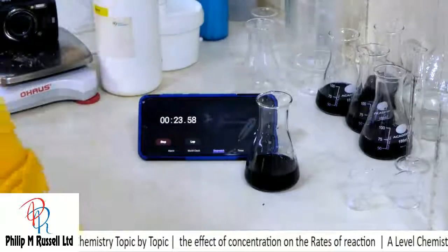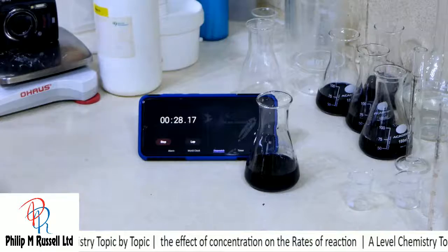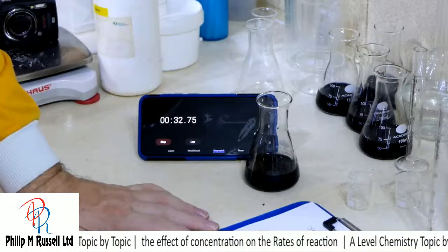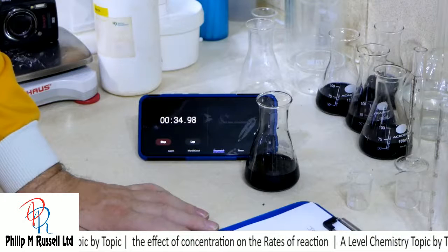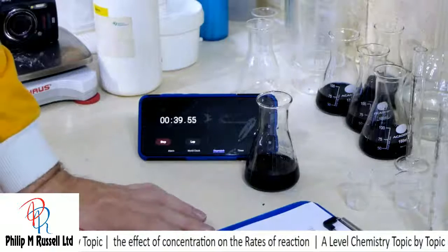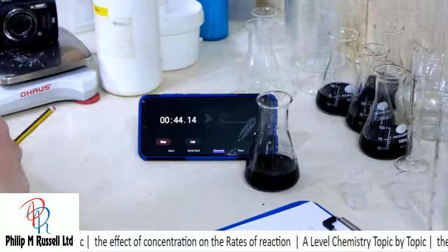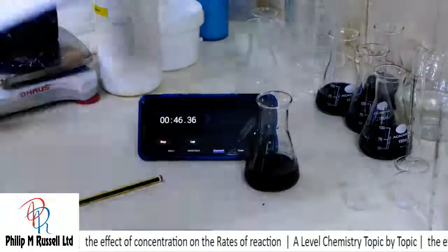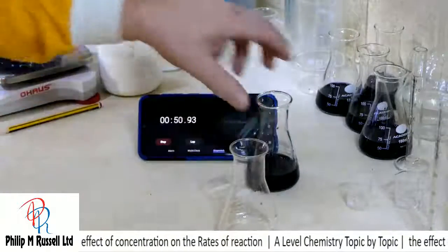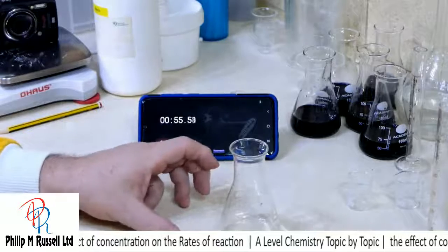So let's record that data that we've got, that when I used 20 mils of water, we got 13 seconds. Let's now use 30 mils of water and see what happens with that. So we can repeat this experiment. 30 mils of water this time.